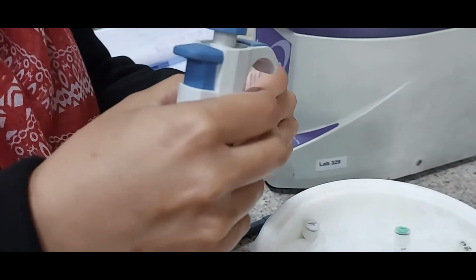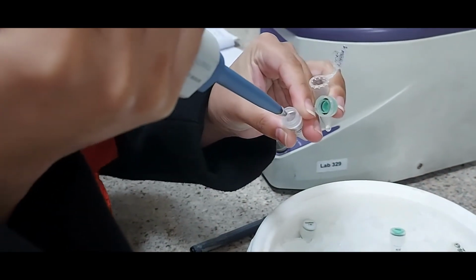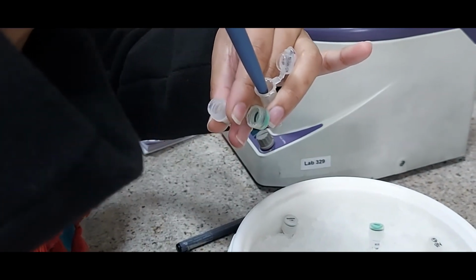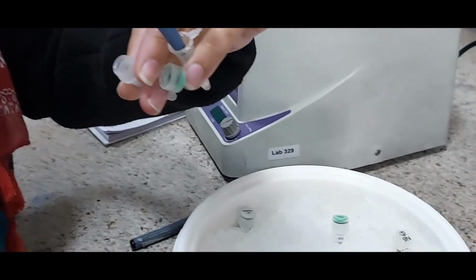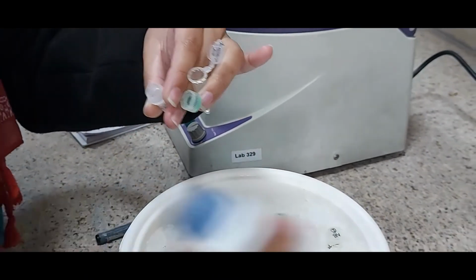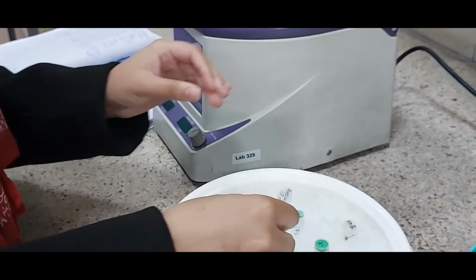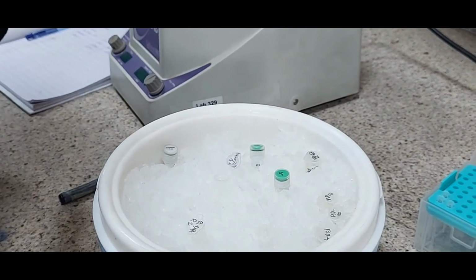So now she is going to take the buffer, that is buffer G, particularly developed for the PvuII restriction enzyme, and she is mixing that buffer with the other constituents. So far she has added the plasmid, water, and the buffer, and at the end she is going to add 1 microliter of the restriction enzyme to this tube, and that will be done.